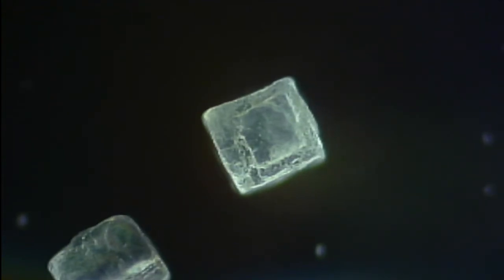This is the lowest power, so you're probably looking at, I don't know, just a couple of hundred power, something. It's always hard for me to figure on this system because it's direct projection. It only uses the objective, the body of the microscope, and no eyepiece, projecting directly onto the bare sensor of the camera. No lens on the camera either. So it's a direct projection technique like you might use in astrophotography, but of course this is microbiology.